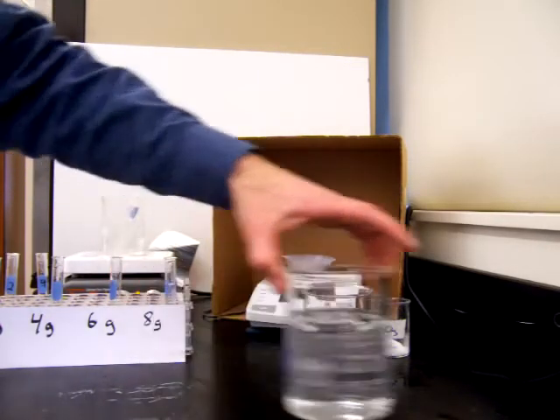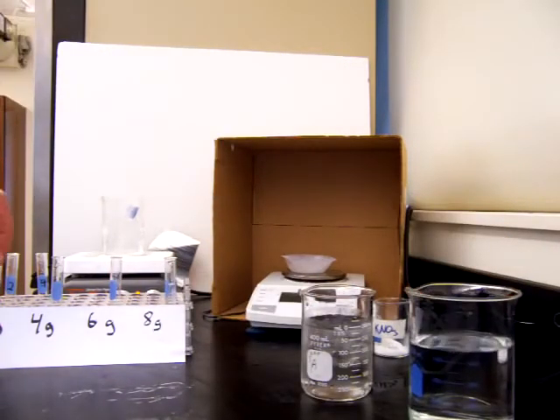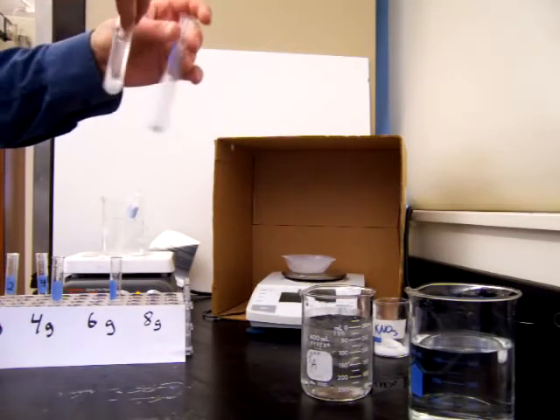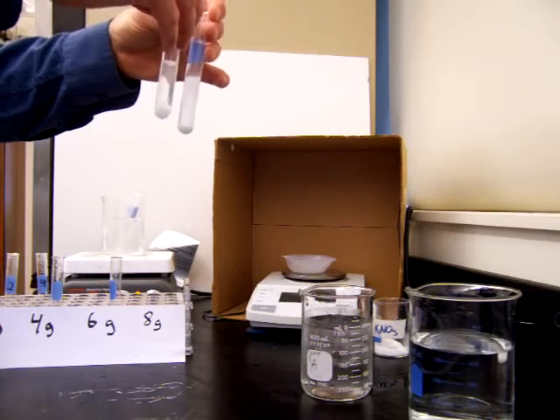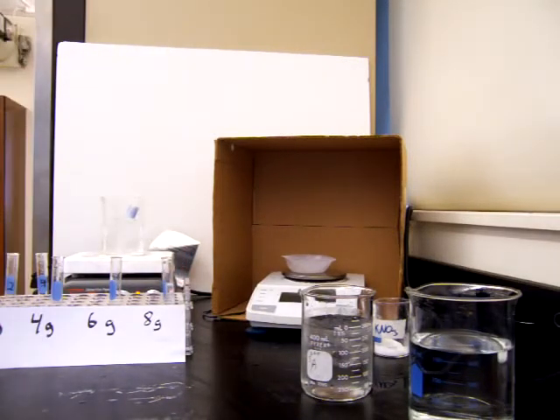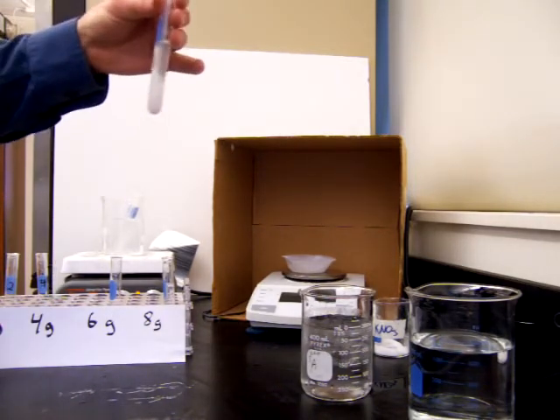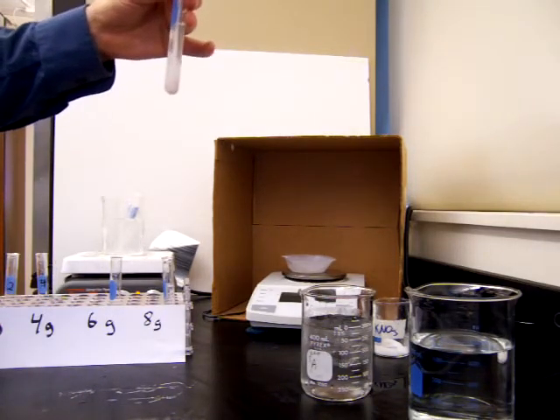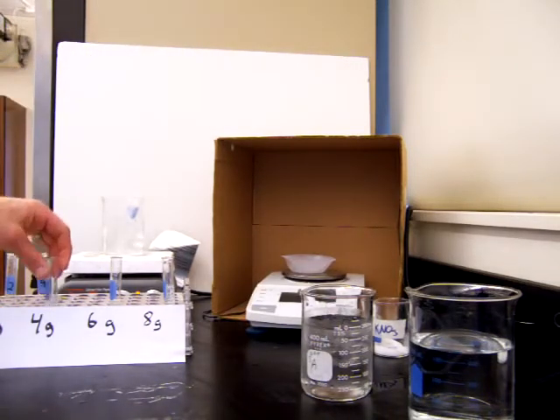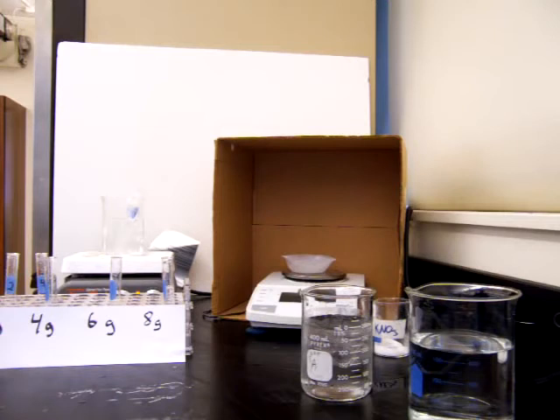Okay, so we made up our 4 solutions with low concentration on up to a high concentration. If you look at the solutions right now, we can mix them around a little bit, and they don't dissolve all entirely right away. In order to make things dissolve faster, there's a couple things we can do. One thing we can do is stir it. That brings the solute particles in contact with the solvent more frequently and makes them dissolve faster. We can also change the surface area by making the particles smaller, or we can use heat. So when we heat things, generally at higher temperatures, they'll dissolve more quickly.